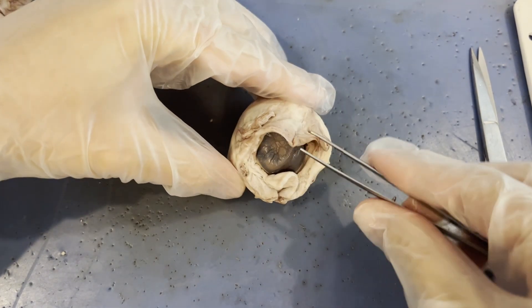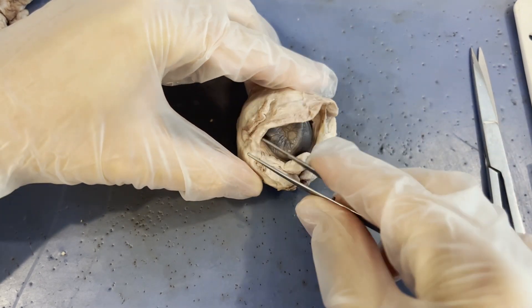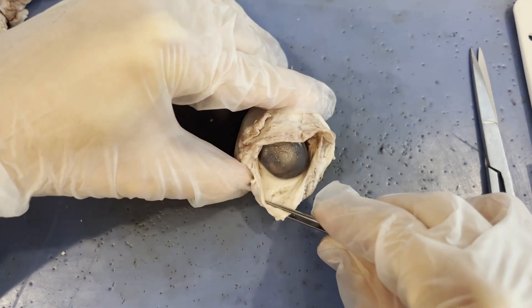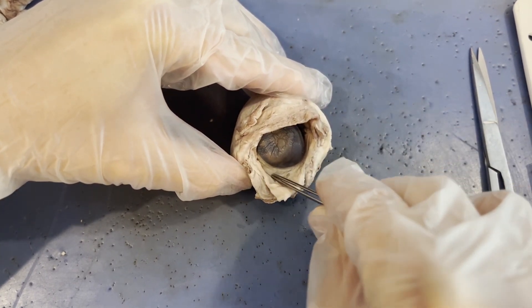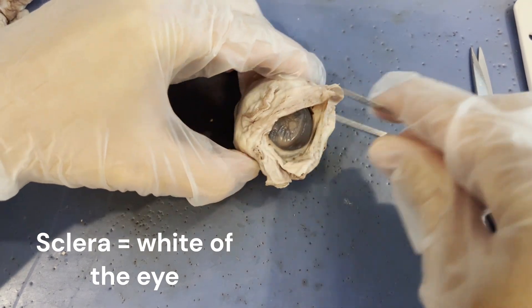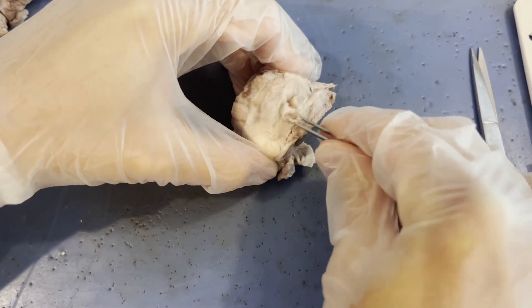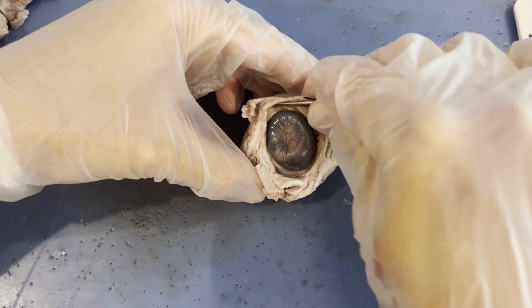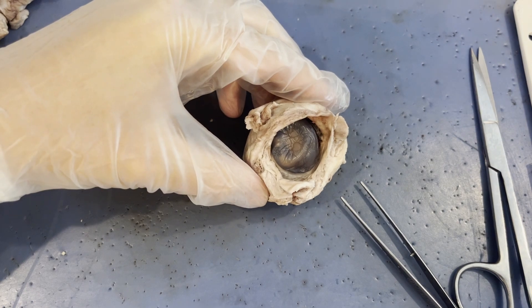Now, I removed a lot of adipose tissue and those extraocular muscles, but I did not remove all of them. In order to see our next structure — the white of the eye, also known as the sclera — I am going to need to remove all of this extra adipose tissue and extraocular muscle. You can watch as I do that and then we'll regroup and look at the sclera.